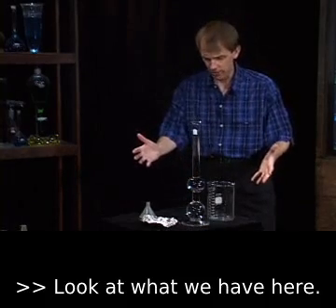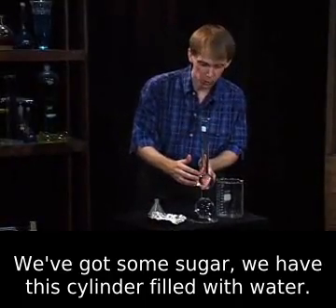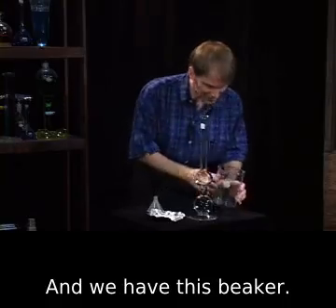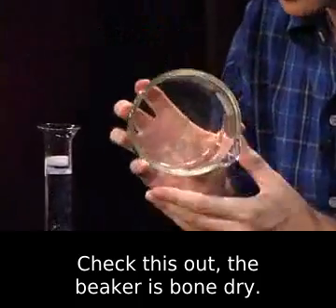Look at what we have here. We've got some sugar. We have this cylinder filled with water. How much water? It's 450 milliliters of water. And we have this beaker. Check this out. The beaker is bone dry.